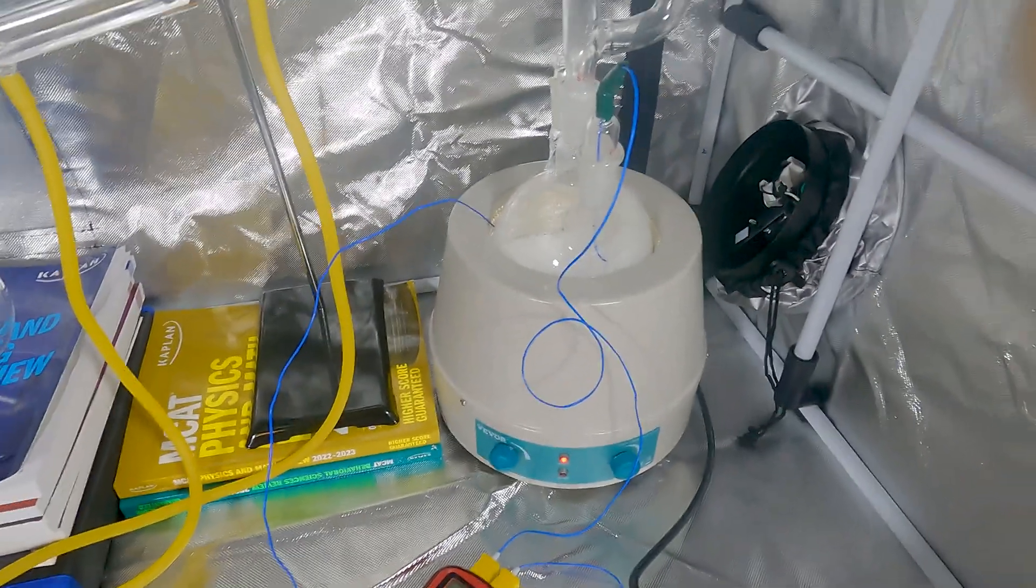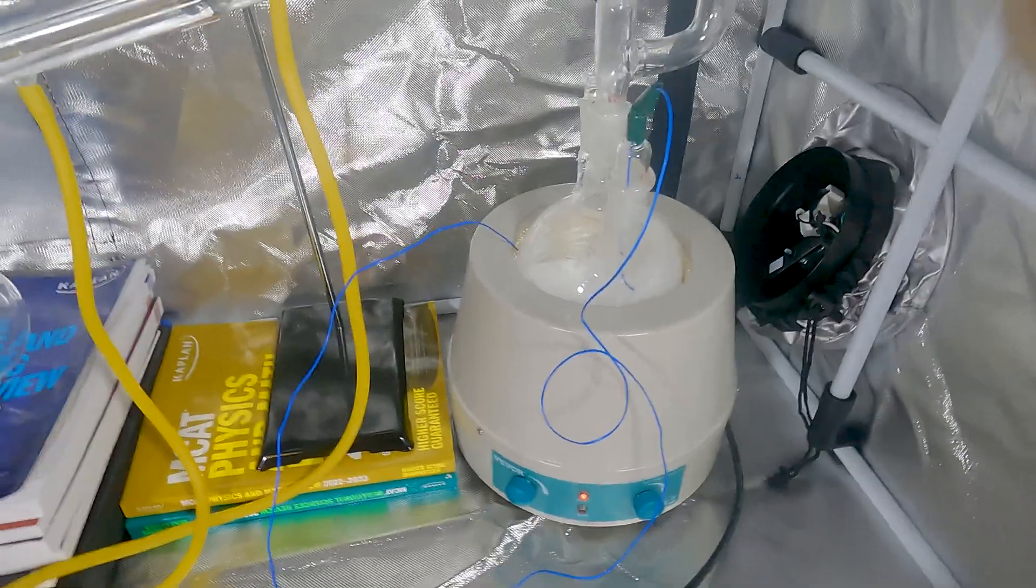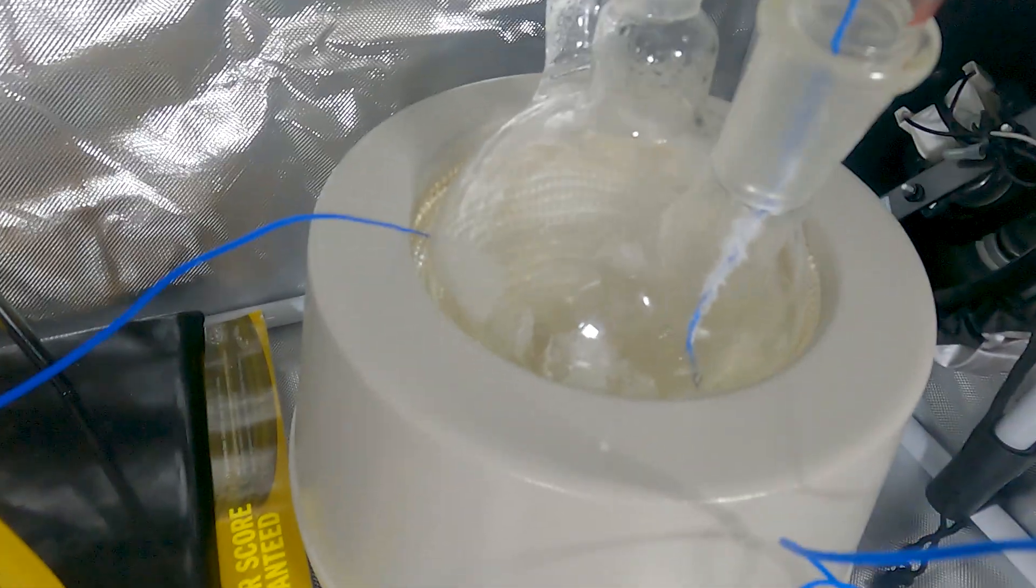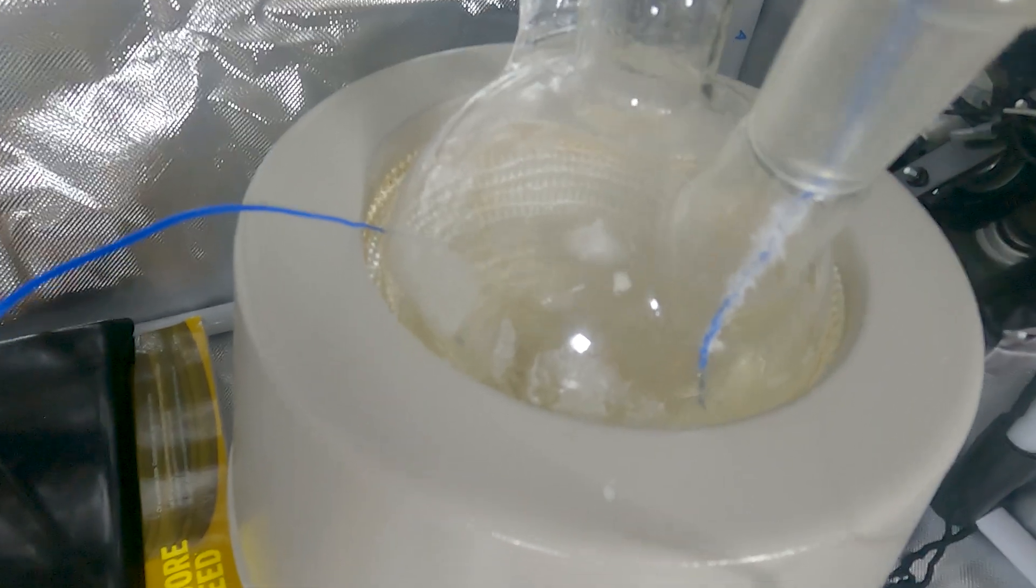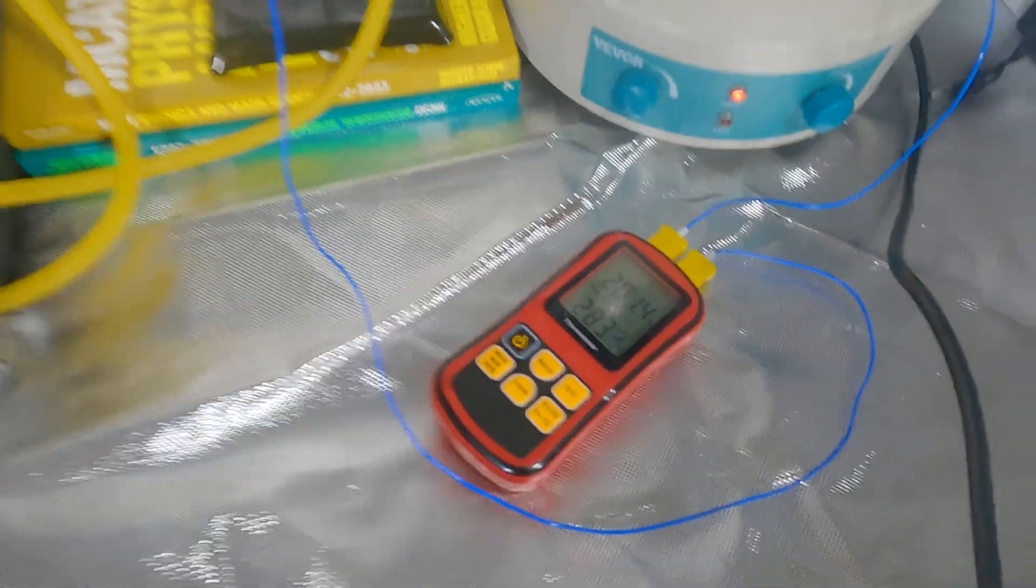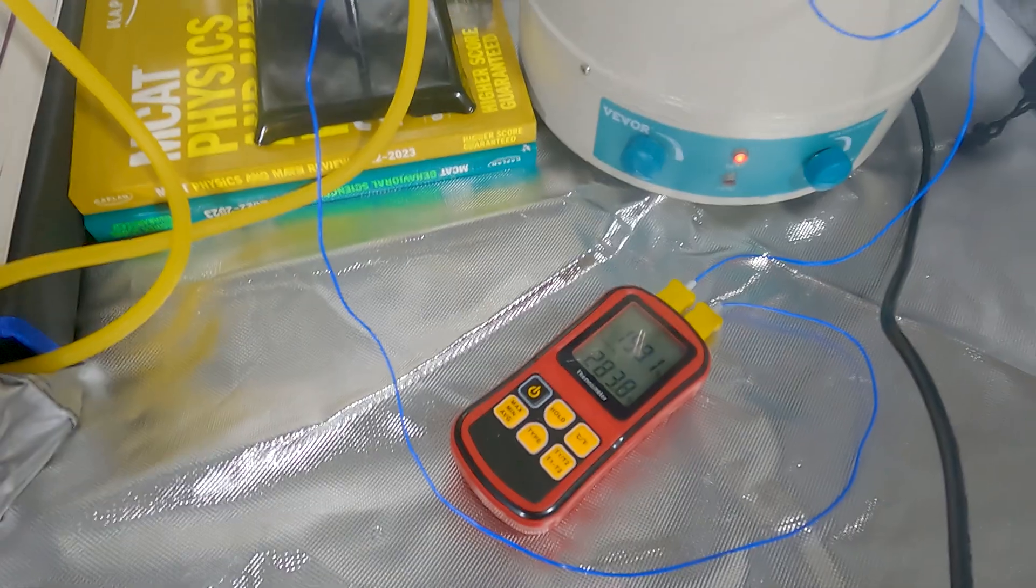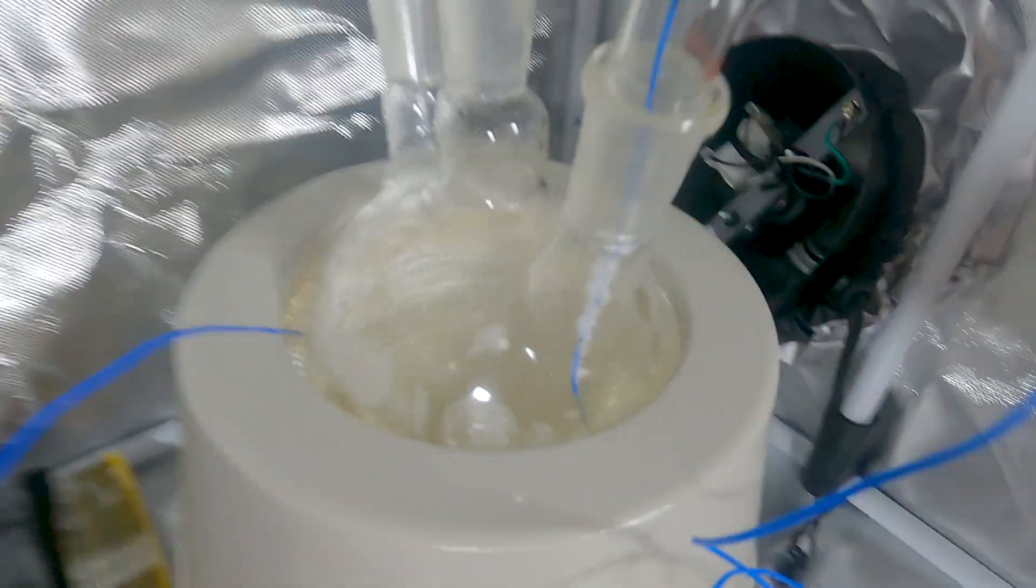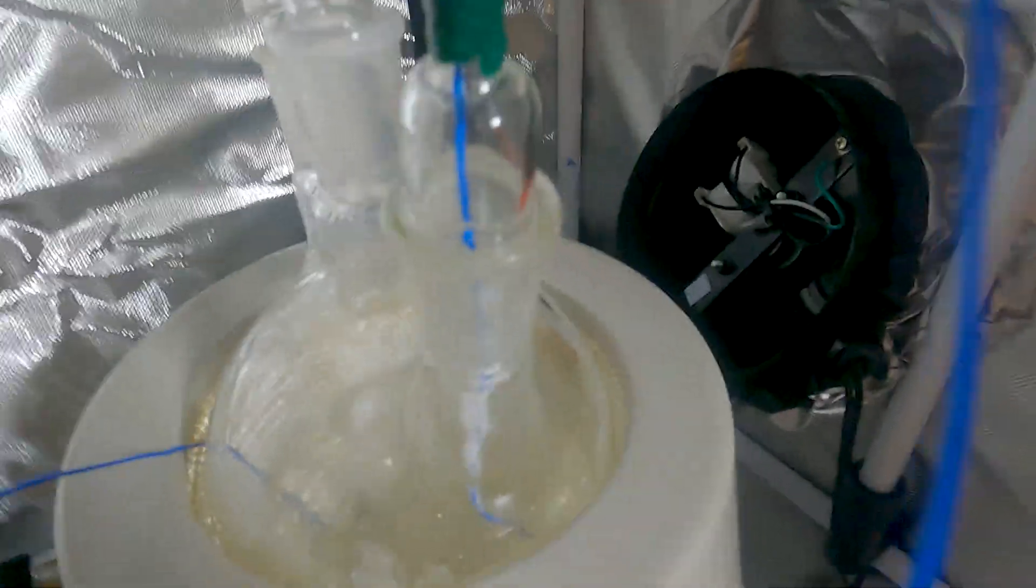You'll be able to see a little bit of condensation on the flask already. And then we'll bring it up to 290 to 295. Okay, we just got about everything melted and boiling nicely. Just cranking up the temperature just very delicately making our way to that 290 to 295 mark. The last of that I believe just disappeared.